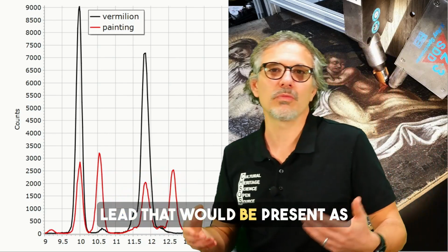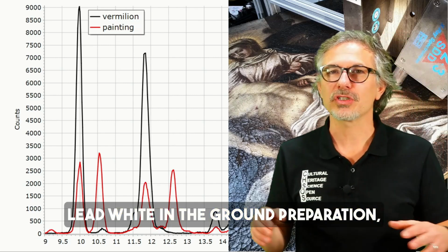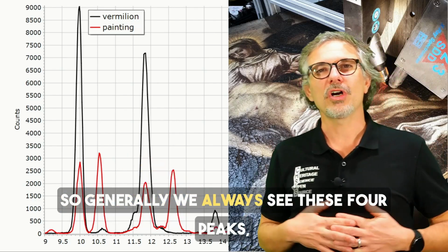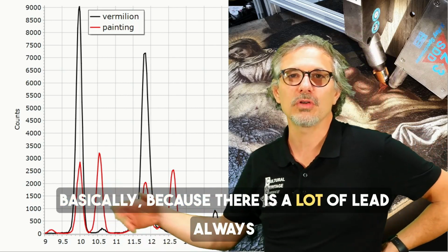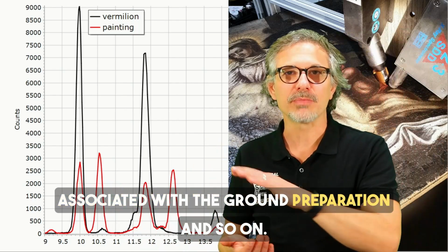The lead will be present as lead white in the ground, in the preparation, mixed with the other pigments and in this layering. So generally we see these four peaks basically, because there is a lot of lead always associated with the ground preparation and so on.